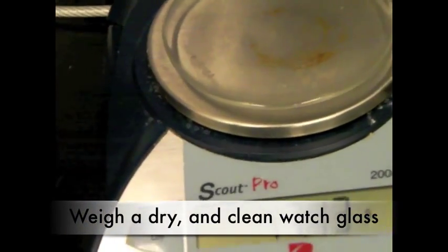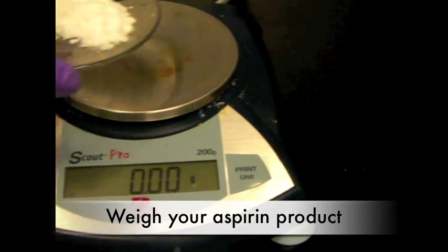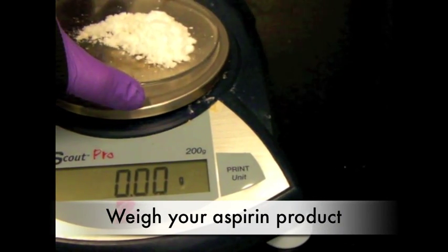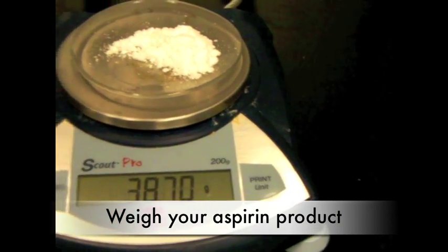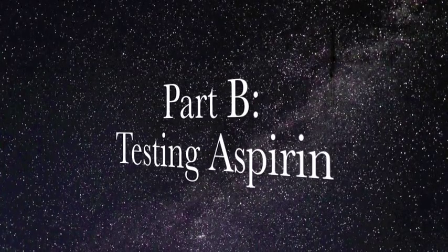Weigh a dried and clean watch glass. Then, weigh your aspirin product with the watch glass and calculate the mass by subtraction. It's time for Part B.